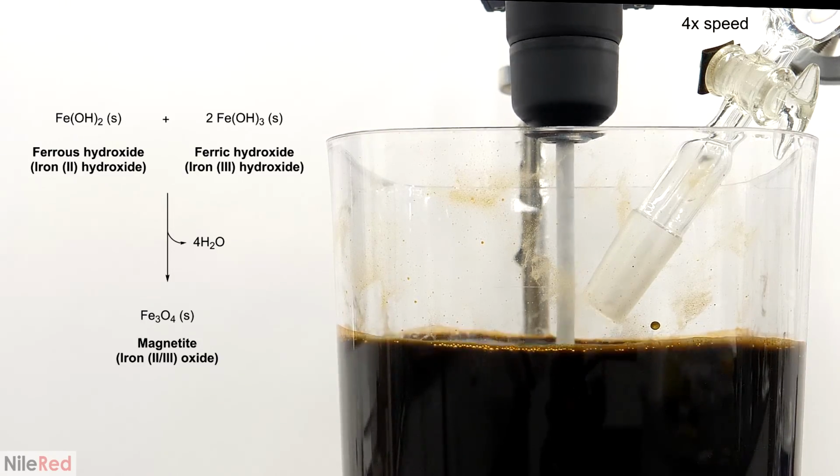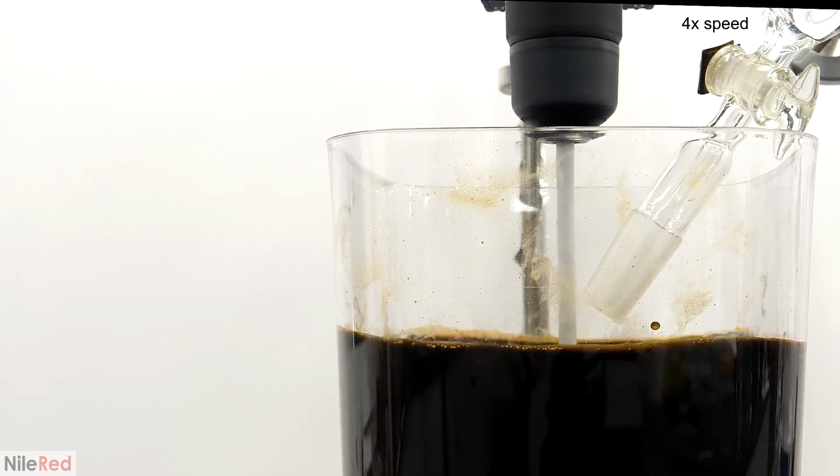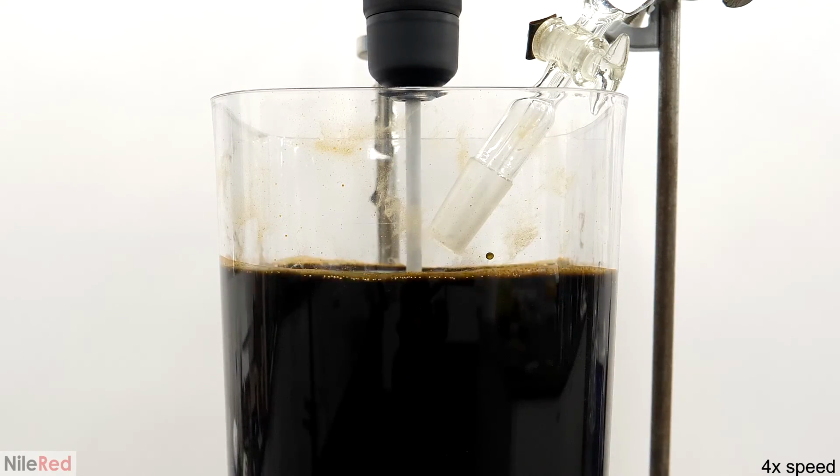Now, if all I wanted to do was make some generic magnetite, I wouldn't have needed this whole setup. I could have just directly mixed my iron 2 and iron 3, and even without stirring, dumped in the ammonia. The reason that I did it this way though, was because I needed the magnetite to form as nanoparticles. This part of the process was surprisingly finicky though, and I found that even just small changes in things like stir speed, or how fast I added the base, could really affect the final result.